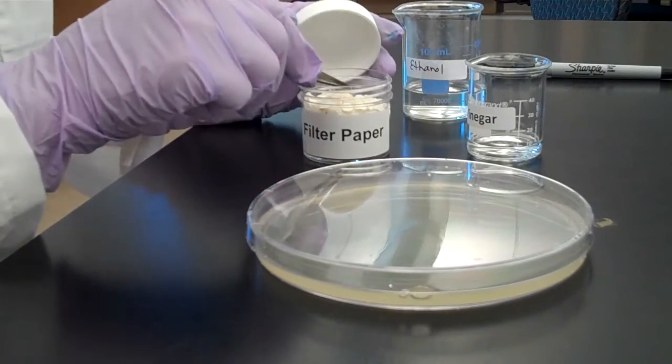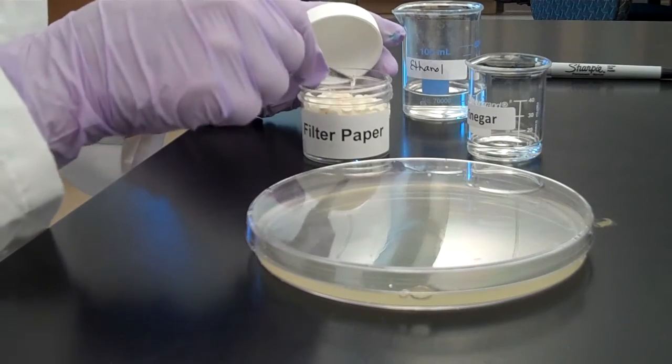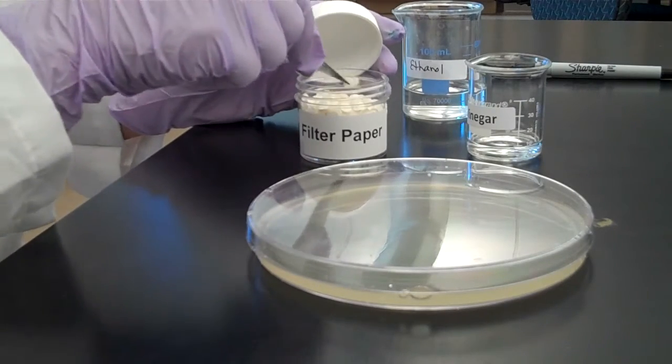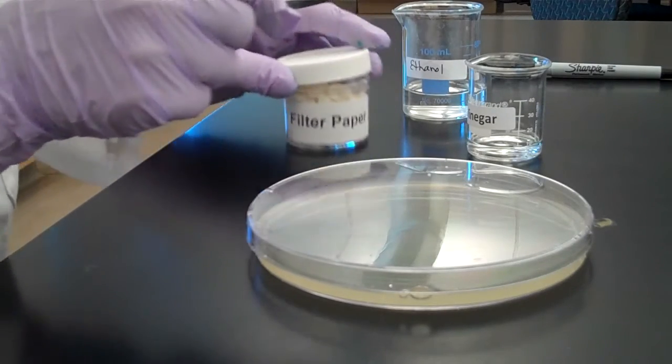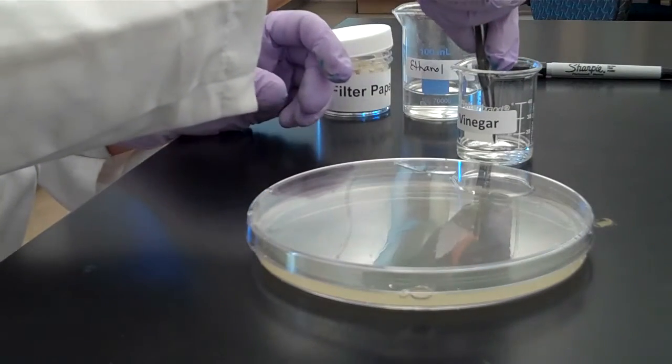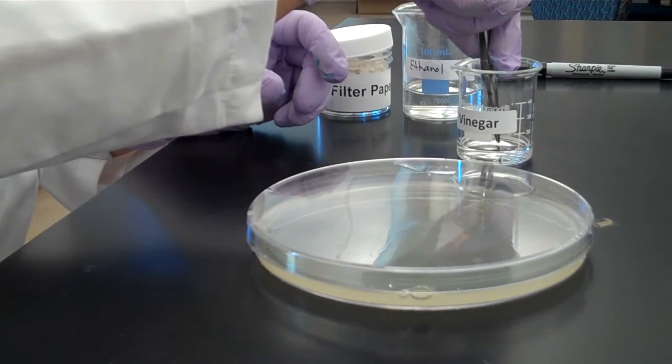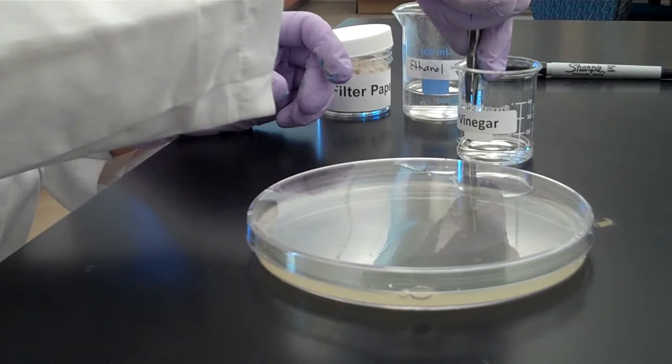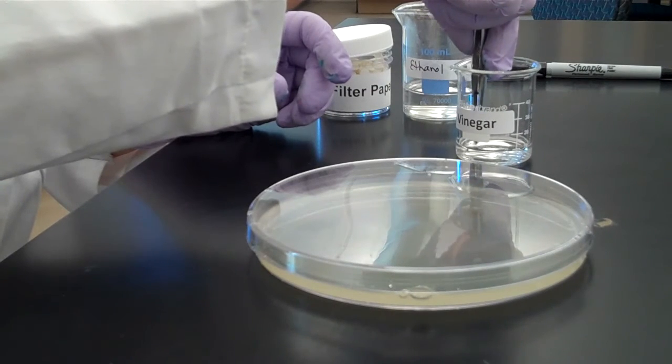Using the tweezers, pick up a sterile paper disc and dip it completely into the antiseptic or disinfectant. Submerge it, making sure to fully saturate the disc with the antiseptic or disinfectant.